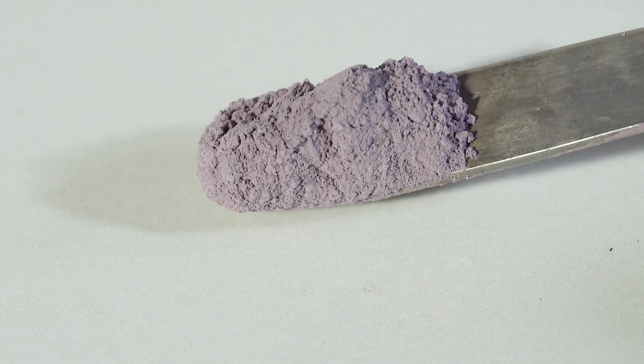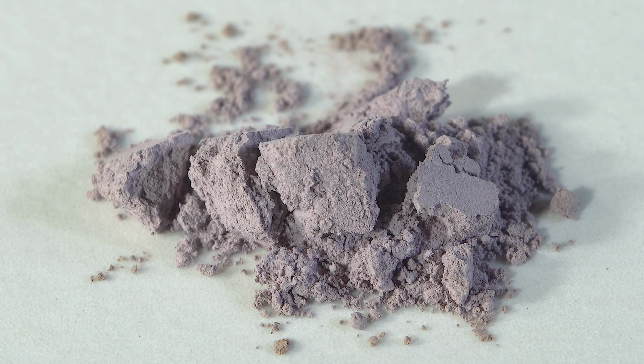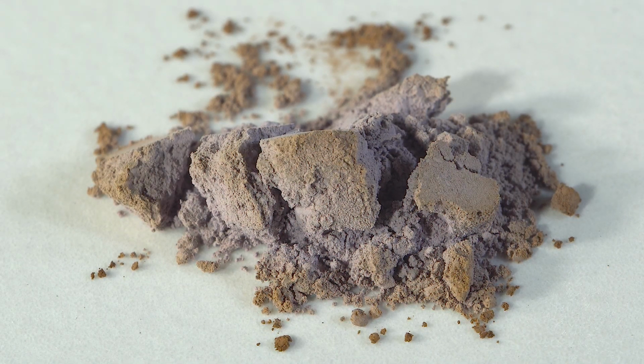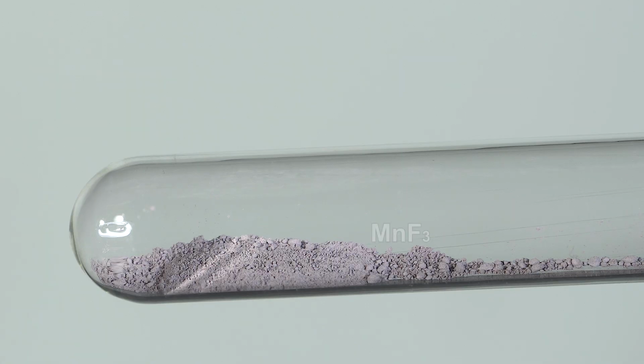If we leave light purple manganese trifluoride in air, it will gradually turn brown. Manganese trifluoride reacts with water and manganese dioxide precipitate forms. Being heated, manganese trifluoride, as well as cobalt trifluoride, decomposes, forming elemental fluorine that we are going to detect now.